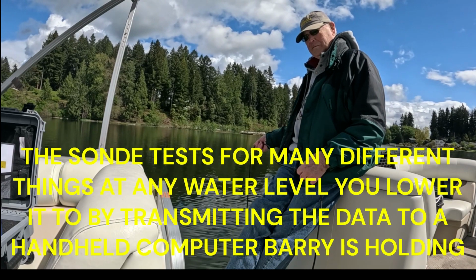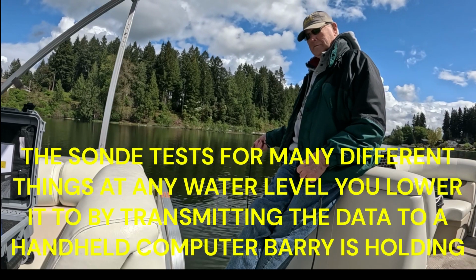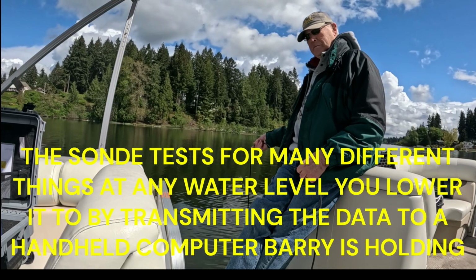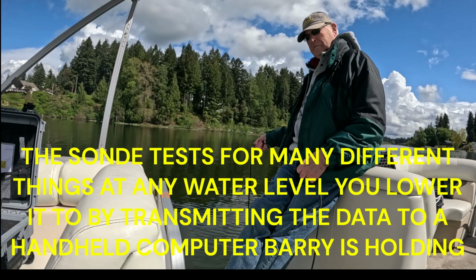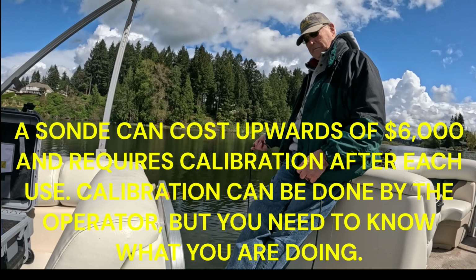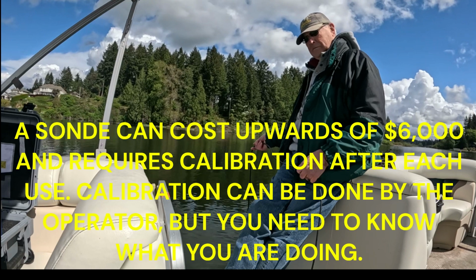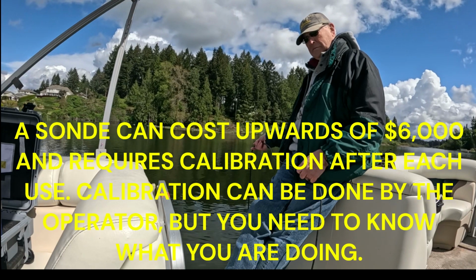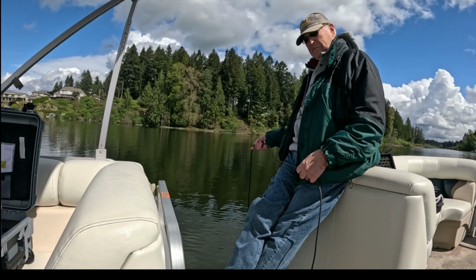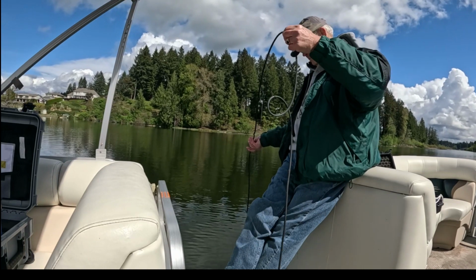temperature is 14.3. pH is 7.65. Dissolved oxygen is 10.02. SPC is 128.9. And turbidity is 1.11. Very similar to the readings at the last location. A little bit different on dissolved oxygen, a little bit higher on pH. Everything else is pretty much the same.